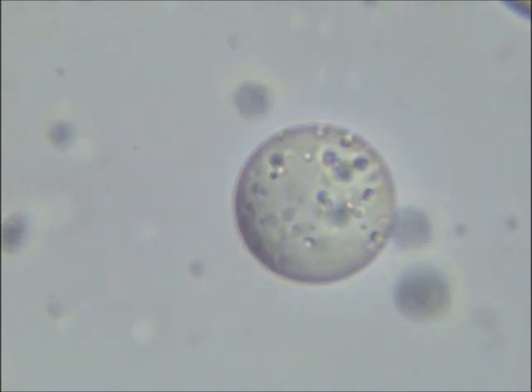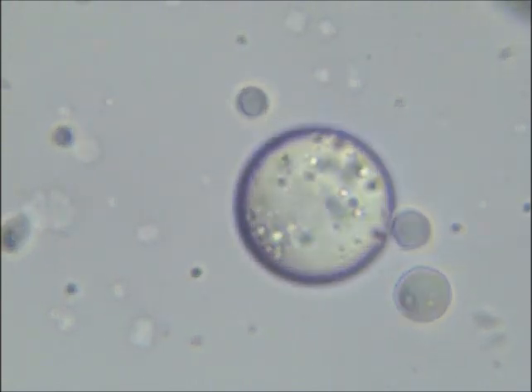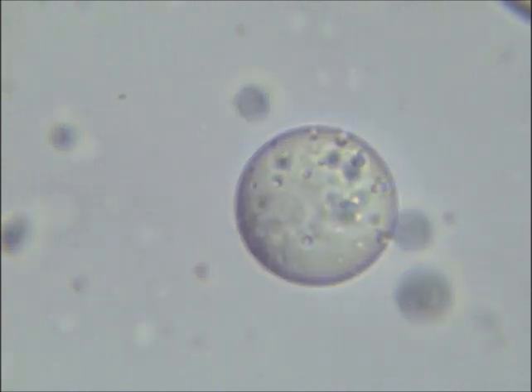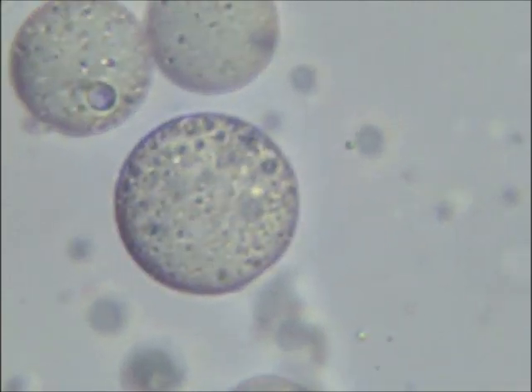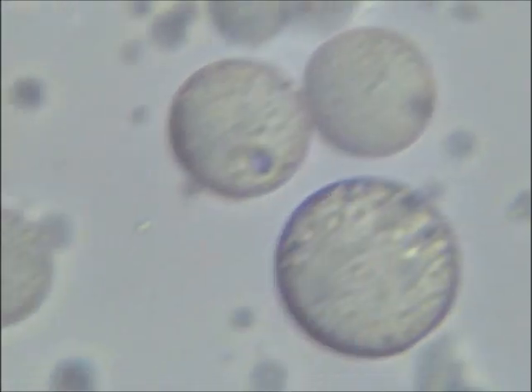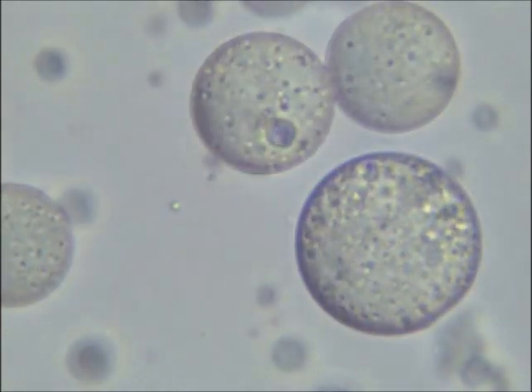In my last video, I showed two vesicles, a smaller one inside of a larger one. The smaller one looked purple, and I believe that this was the result of chromatic aberration and not of any hematoxylin stained nucleic acids like I had originally thought.